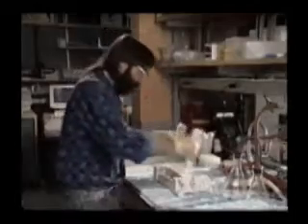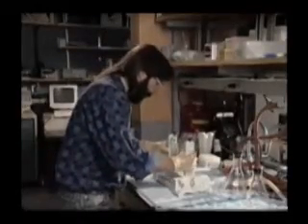SDS-PAGE has a lot of uses in biochemistry. What we're going to do with it here is determine the size of the chains and the proteins that are making up this STF-7A complex. We need to know the first piece of information, how big is each chain, before we can determine how big is the complex where we have many chains together. Here's the setup for SDS-PAGE.